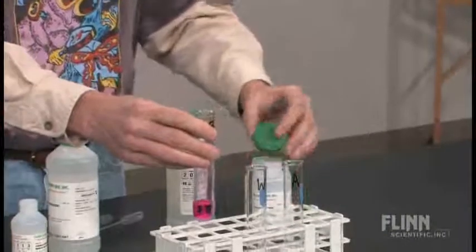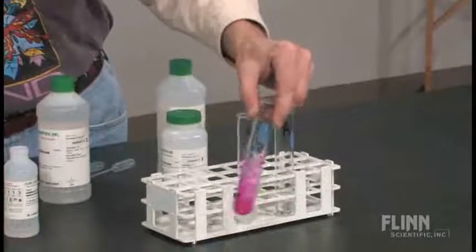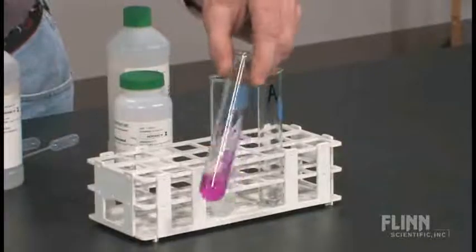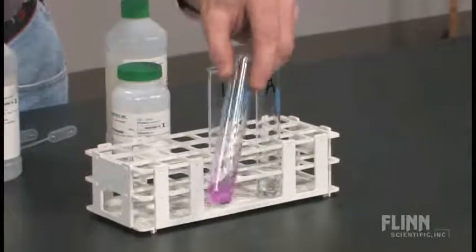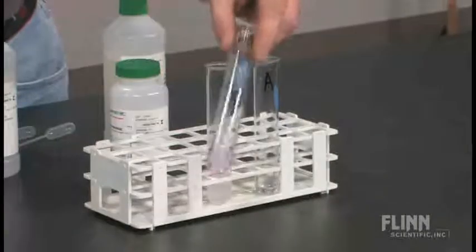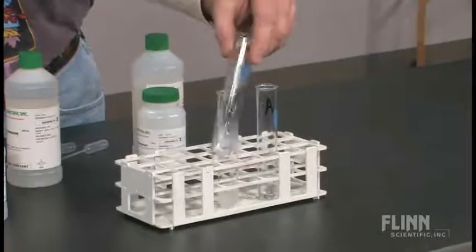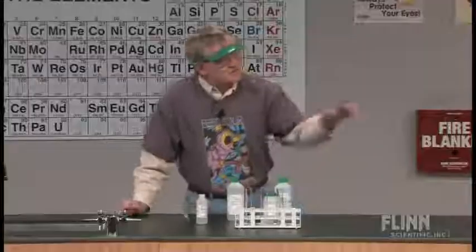I'm going to stir it a bit. This will take a little bit of time, but take a look — give it a few seconds and we'll swirl it around. You can see it's starting to work. What's happening to that pink color — is it getting darker? In fact, phenolphthalein in a really strong base is colorless. The pink color disappears.